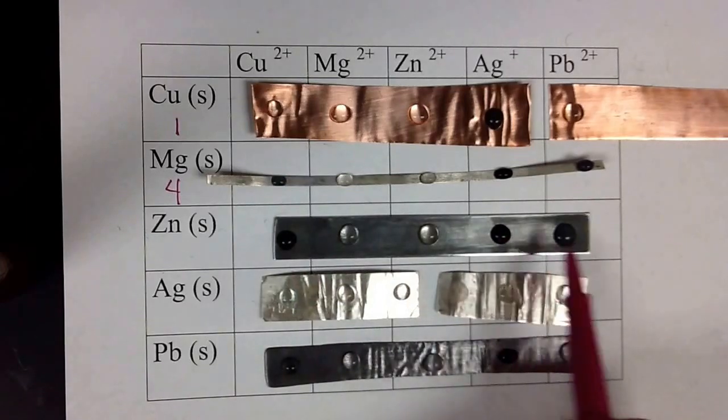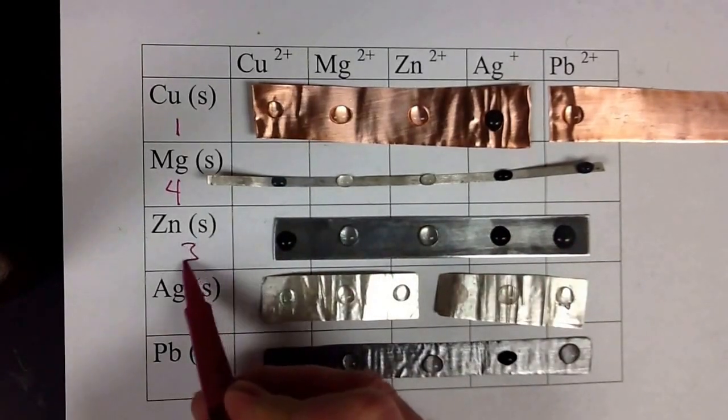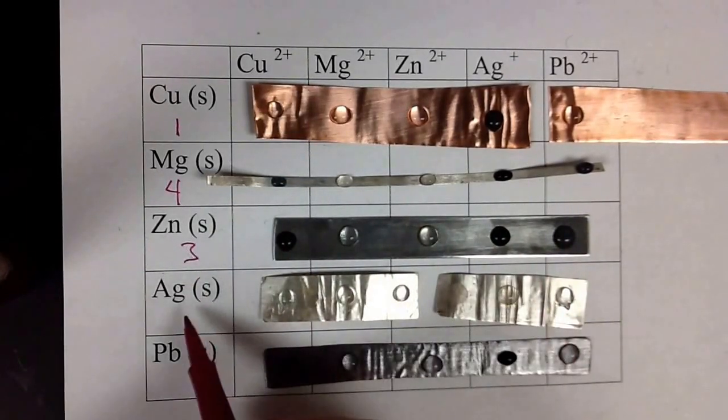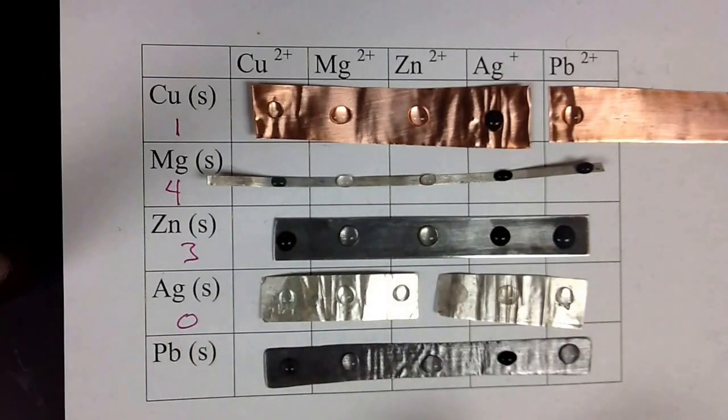We have one, two, three reactions here. You have zero reactions for the silver. And we have, looks like a reaction here. The lighting isn't very good. And here.